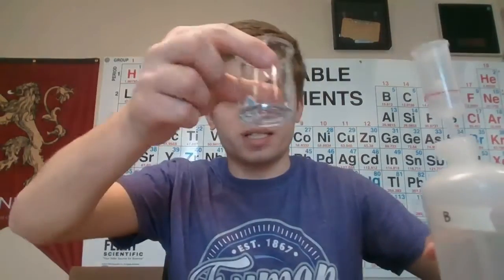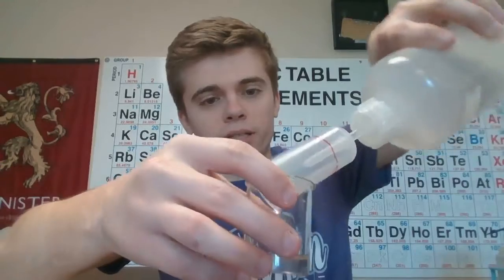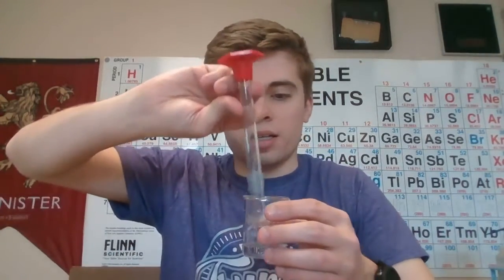Okay, so now that you recorded the data for the first one, we're going to go ahead and do the second one. In the second one, we're going to do 10 milliliters of solution B. So I have measured that out, and I'm going to dump it in here. And we're going to do 9 milliliters of volume of the solution A and 1 milliliter of water, which I've actually already mixed up into here. So once again, we're going to time how long this reaction takes place.